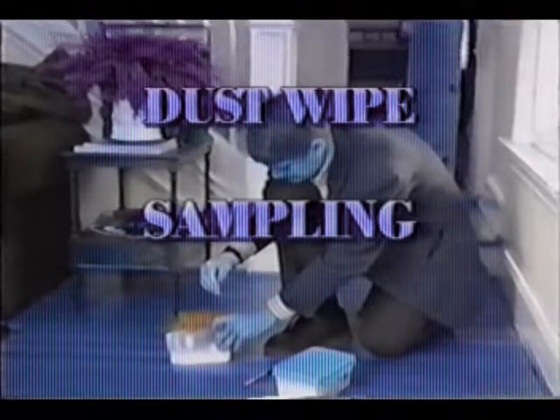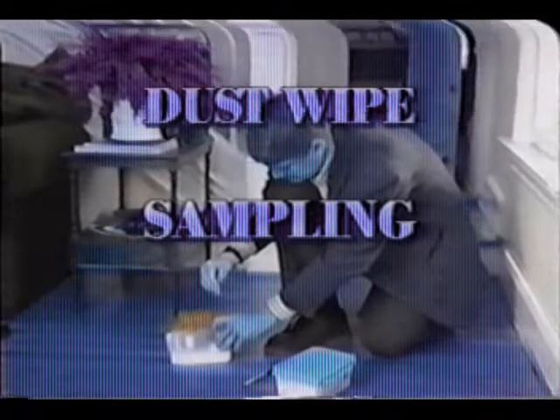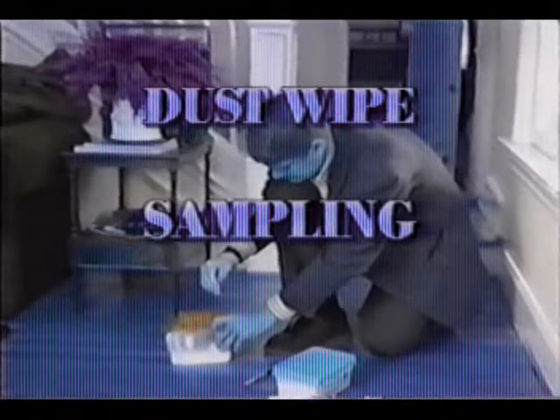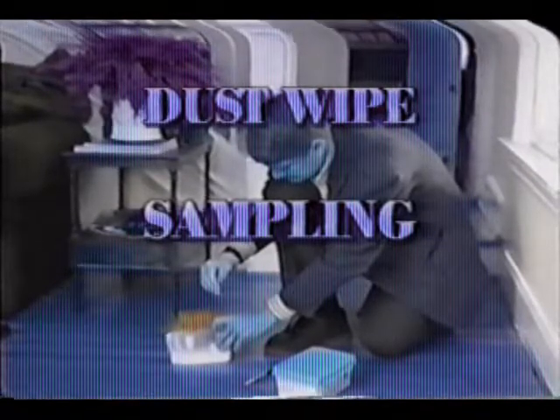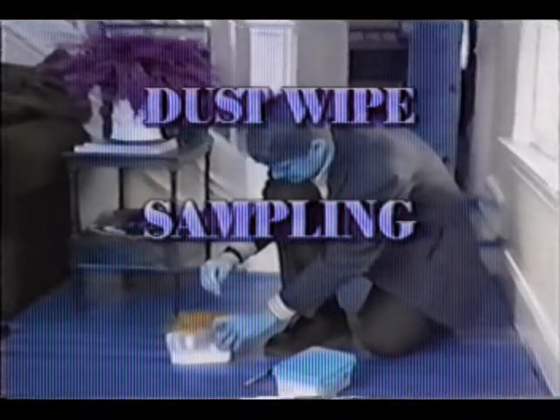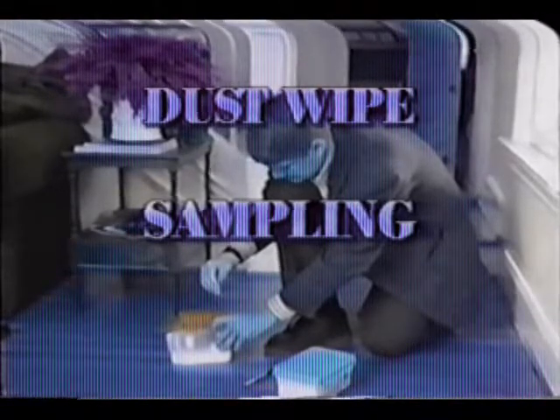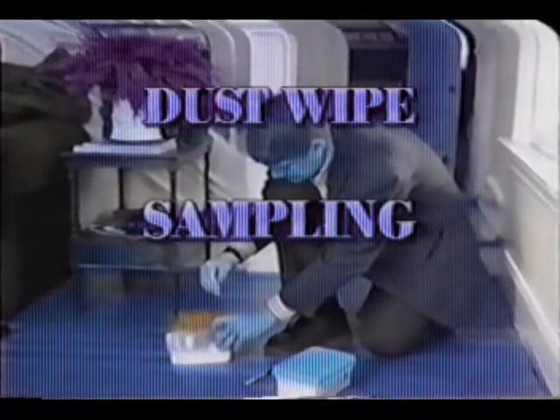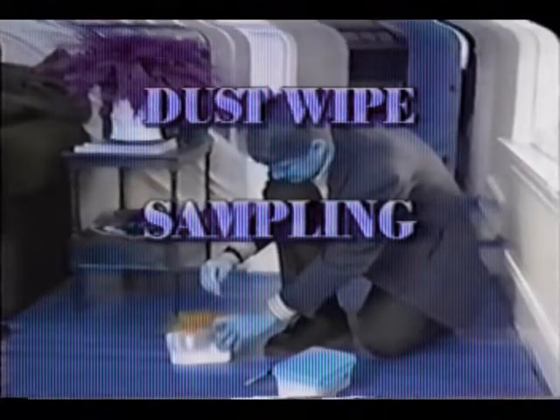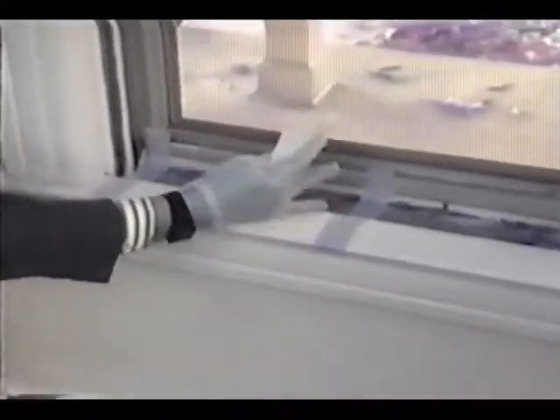Wipe samples for settled dust can be collected from floors, both carpeted and uncarpeted, interior windowsills and window troughs, and other reasonably smooth surfaces such as stair treads. In most cases, samples should come from areas where child contact is highest, such as play areas, or the floor inside doors where foot traffic is heaviest, and from windowsills or window troughs, preferably from the most commonly used window in a room. Single surface sampling will be demonstrated here. Your instructor can describe how this method should be modified for composite sampling.